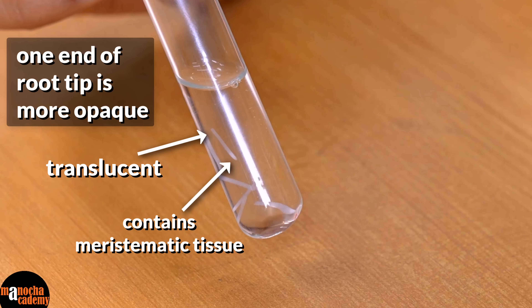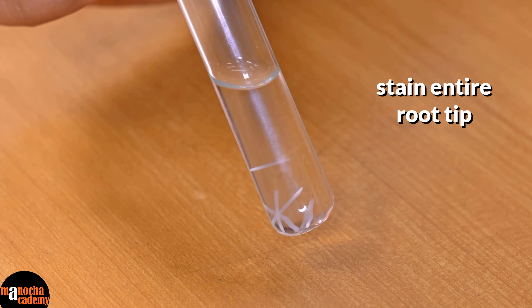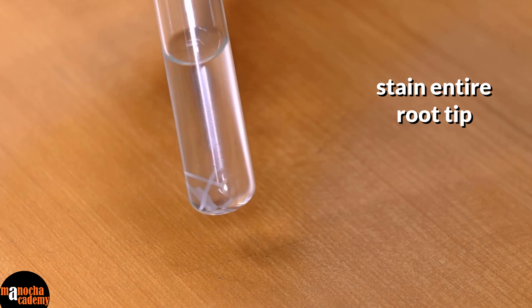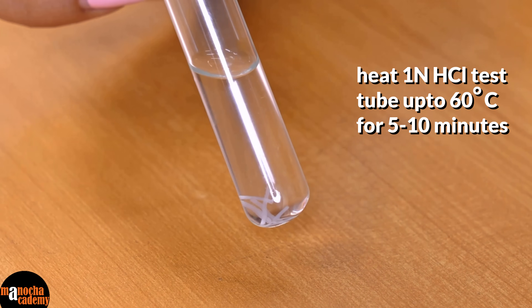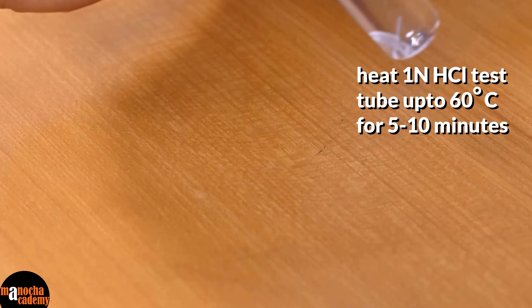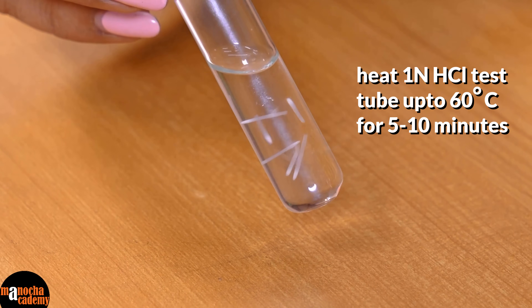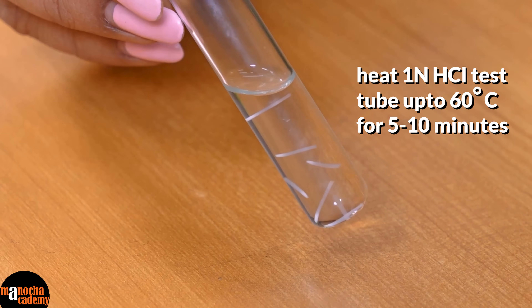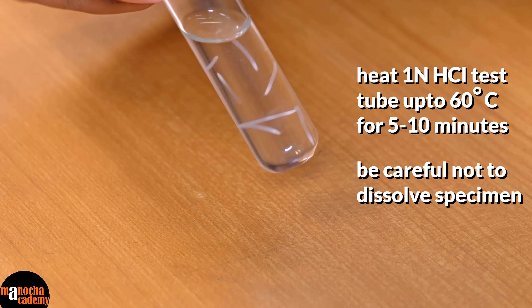What we will do is first carry out the process — stain it — and then take only the tip. For that we will have to heat this at 60 degrees Celsius for about 5 to 10 minutes. Now here we have to manipulate a little bit: if you see that when you are heating it the tissue is almost dissolving or getting cooked, then stop heating.